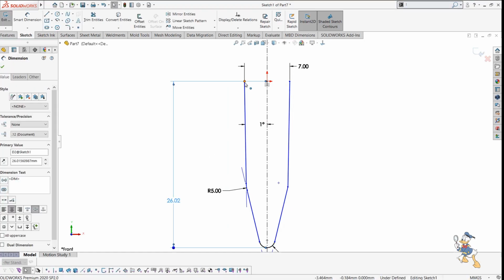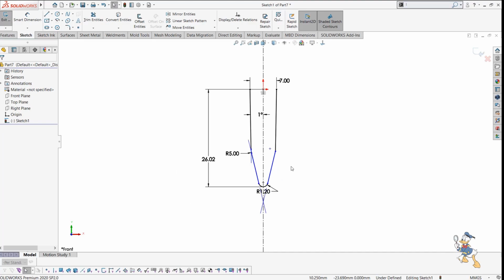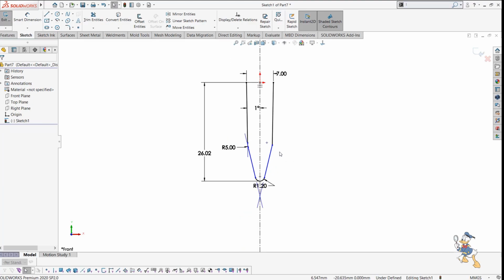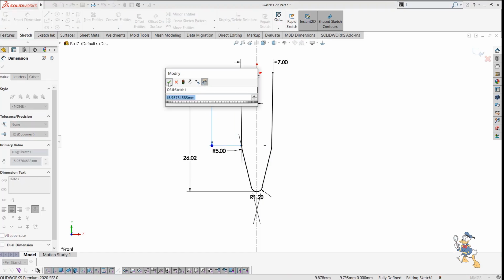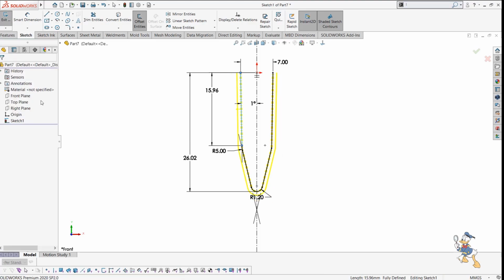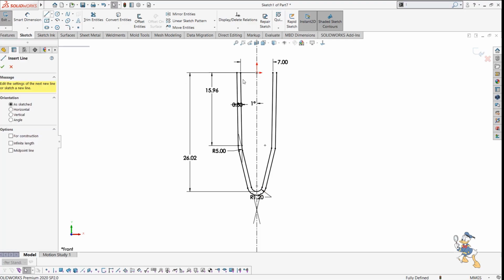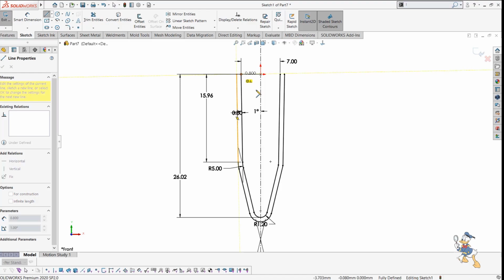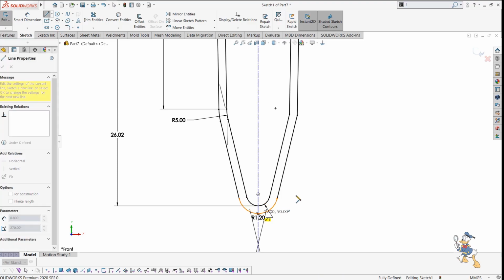It is okay for me, and I just need to select this one, coincident, yeah, and suppose we just need to generate a dimension from here to here. And this one is also okay for me. Suppose I just need to create an offset of this about 2 mm, or we can say 0.8 mm. Yeah, right now it is sufficient for me because it generated baseline geometry. So I just need to uncheck that option, as I don't need the base geometry to be construction. So I just need to generate some lines as well for generating a revolve feature for this.